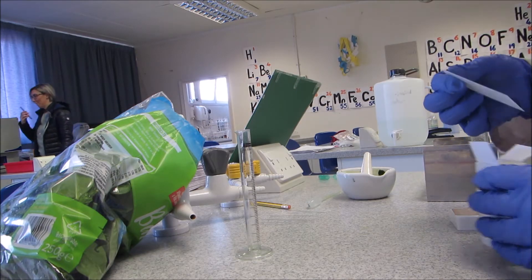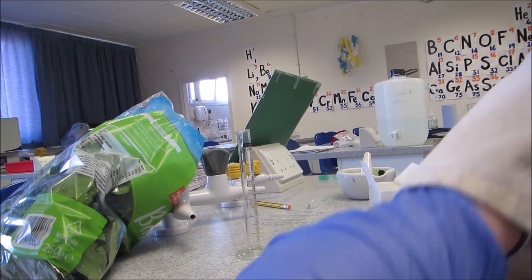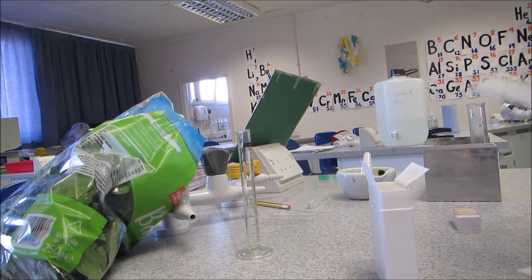Take a TLC plate, measure one and a half centimeters from the bottom, and draw a line.